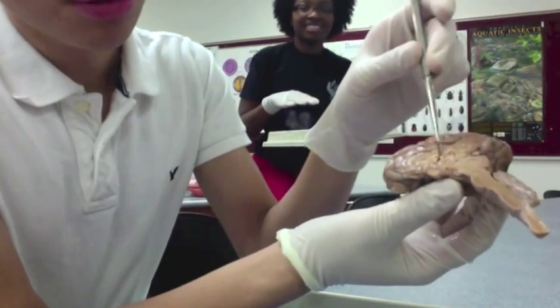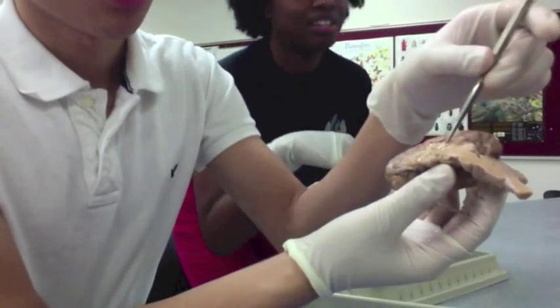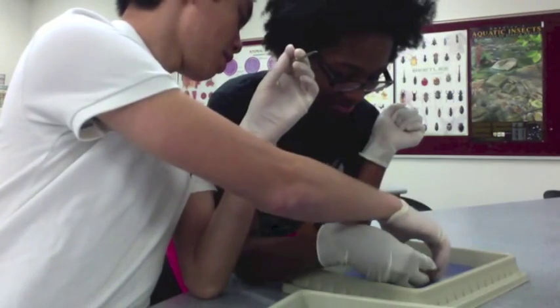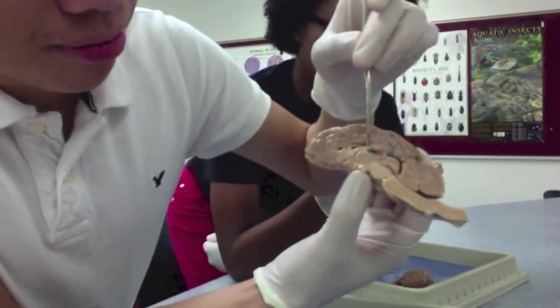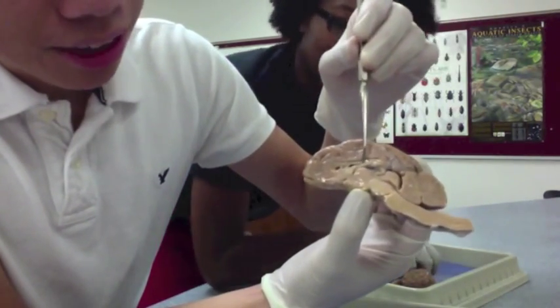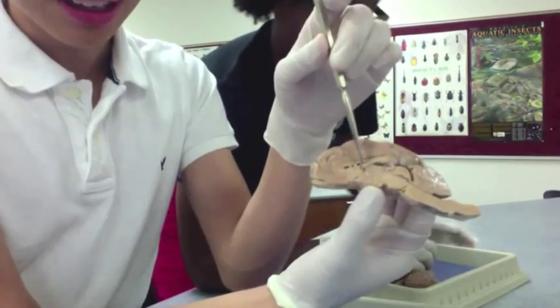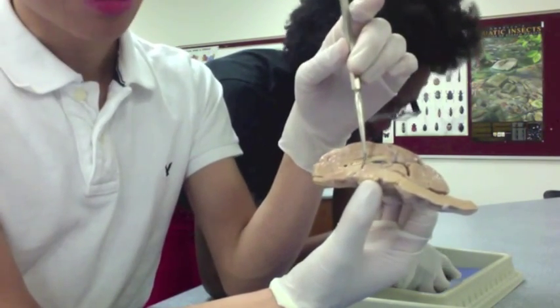You have your lateral ventricle, which is in between your corpus callosum and your fornix. Your septum pellucidum is the same general area as your lateral ventricle. So you see the little space in between — that's your septum pellucidum or your lateral ventricle. The line above that is your corpus callosum, and the bottom line is your fornix.